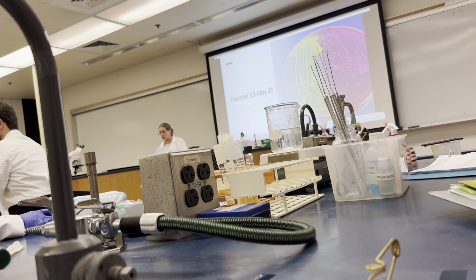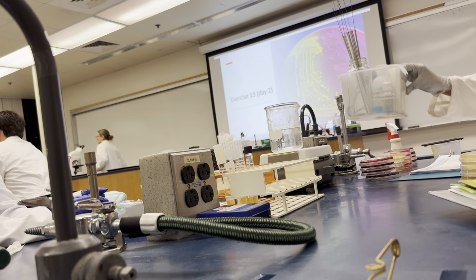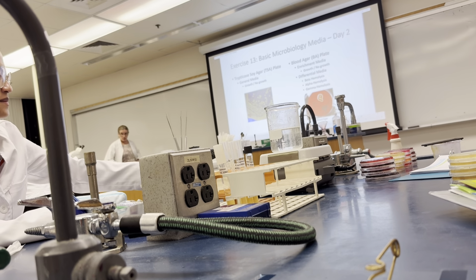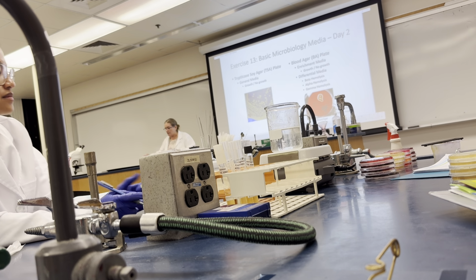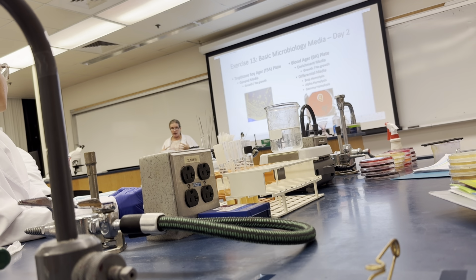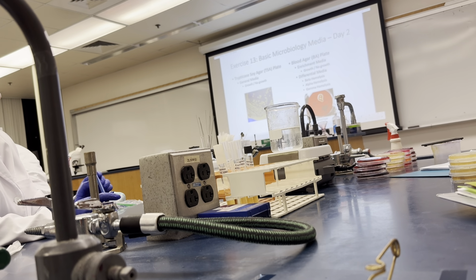Okay, we're going to start out with trypticase soy agar, the TSA. So we're looking at TSA by itself. Now you'll notice when you're recording your results, we have observations and we have interpretations. Observations are what you observe, what you see, and interpretations are how we take that information and provide ourselves with information.